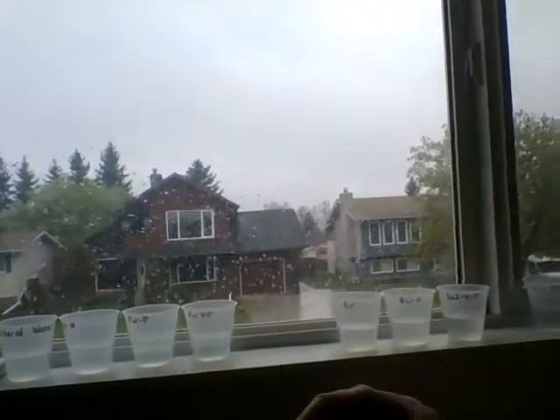And then because of this beautiful rainy weather that we've had the past 3 days, I was able to collect lots of rainwater. Obviously, there's just a little of it. So we have rainwater as well. I tried to collect it from a bucket that was quite clean. Now, again, there can be contaminants in the sense that it is coming off of my shed. So there could be some contaminants coming off from the shingles or from the pipe itself that could be changing the water. So just always keep that in mind.